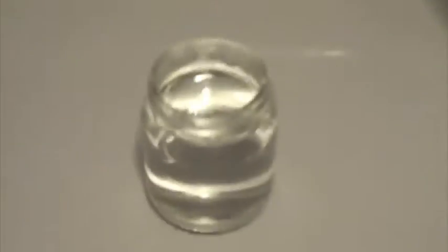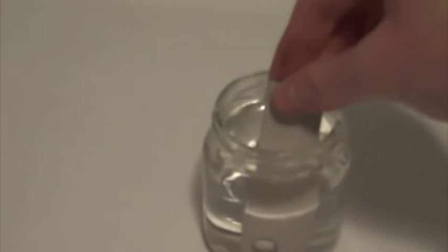Now set it down and add your magnesium. Soon after it is added, bubbles of hydrogen will start coming off.